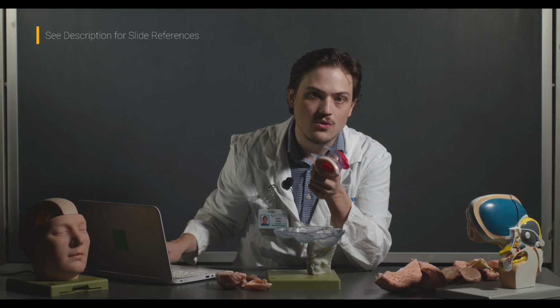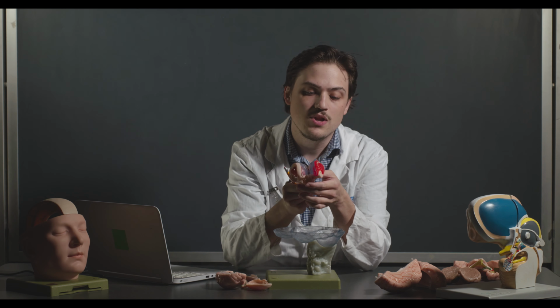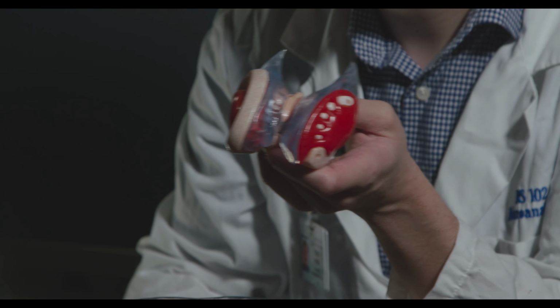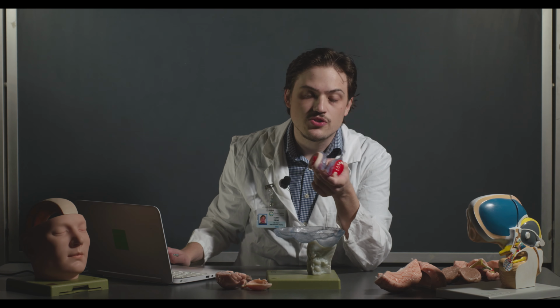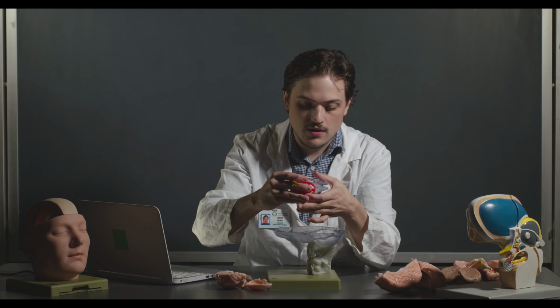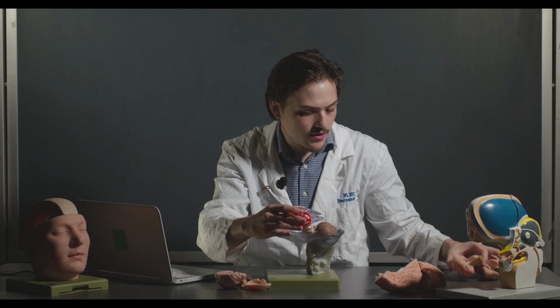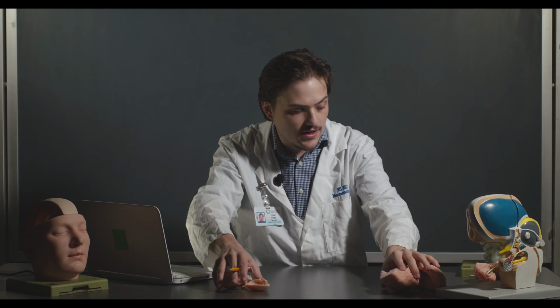There's a nice video on your lecture slides. There's a YouTube link, and that actually shows you a 3D computer model that shows the internal capsule kind of coming between these structures really nicely, which I highly recommend checking out. Okay, so there's a couple of slides that essentially show you more or less what I talked about. I'm actually going to put this back together briefly. I'll do that later. Just going to put this off to the side for a second.